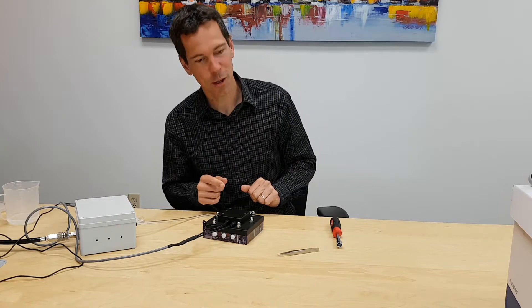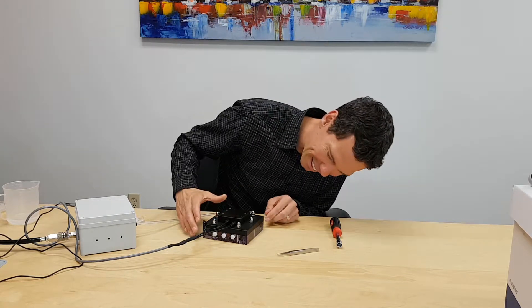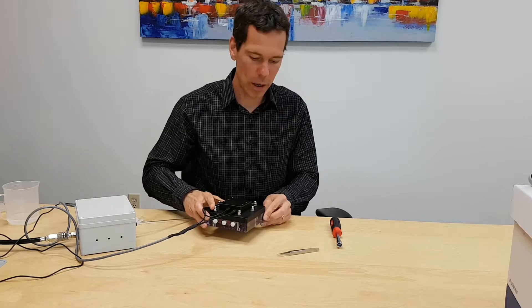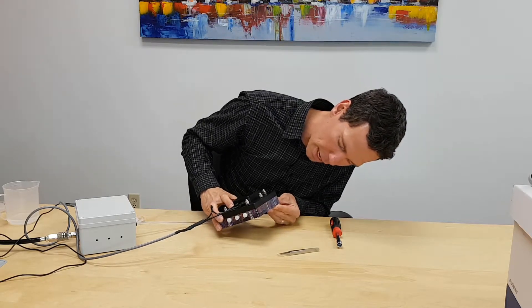Now, I need to push the start button. There we go. Excellent. So here we go. I'm just going to hold that up so you can see the pressure that's happening.